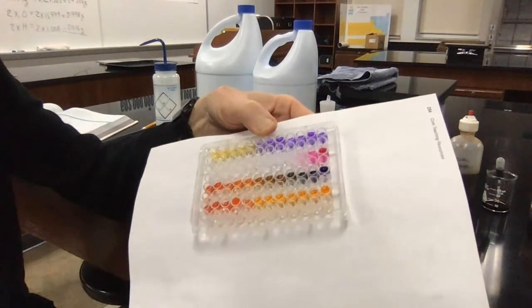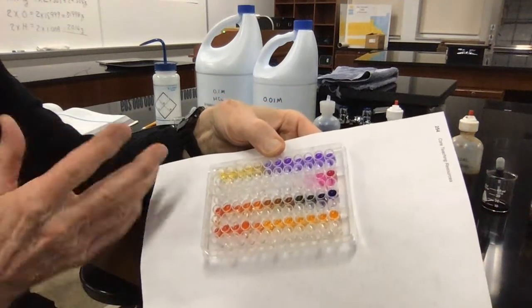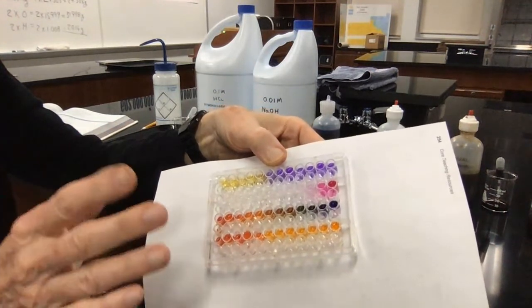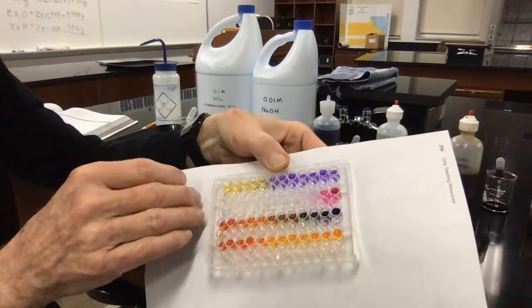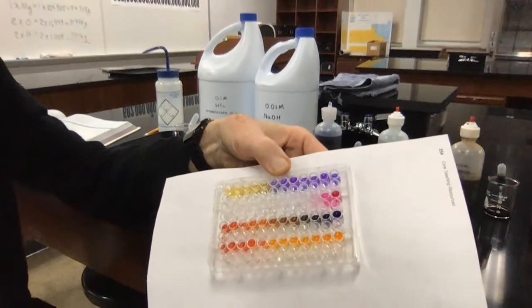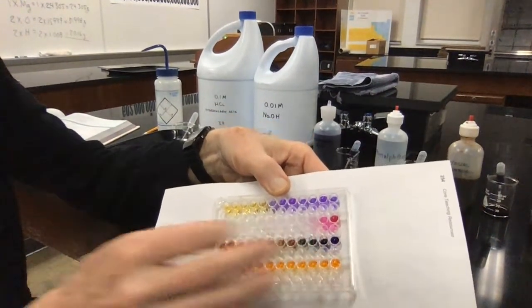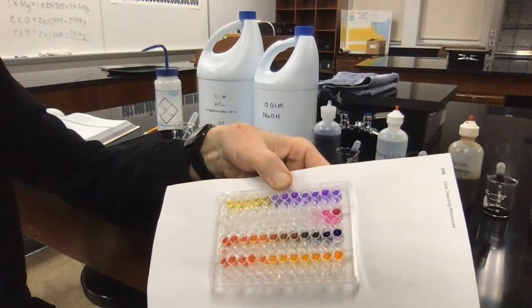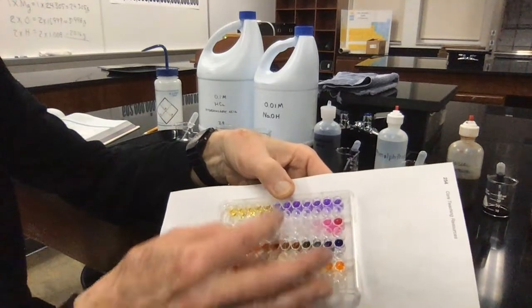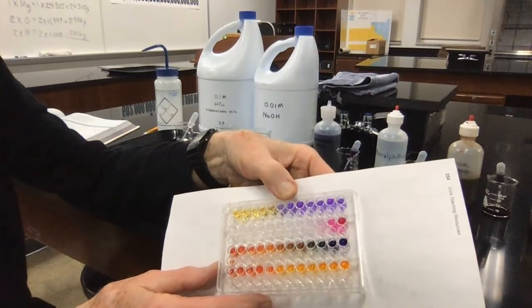And the practical use of this is when I'm doing a titration or a blending of acids and bases, if I'm trying to figure out where's the switch off a strong acidic condition to a strong basic condition, what I frequently want to do is use a universal indicator with it, because that shows me the best set of color changes where I can get a sense of where my neutral is. So the color switch is right in this row with a pH of 7.